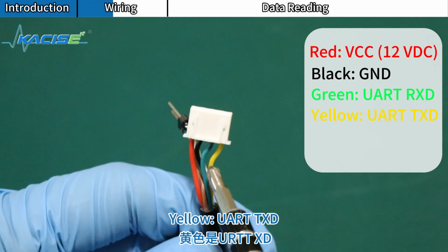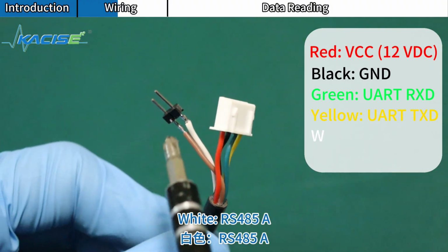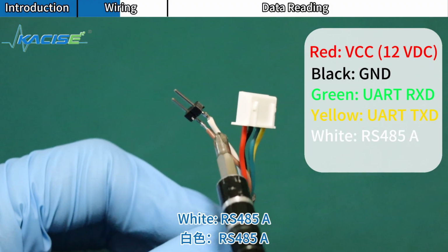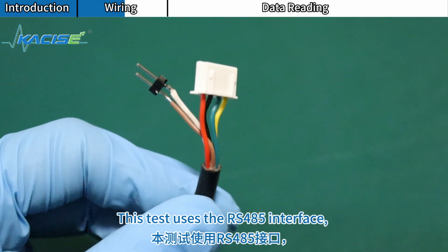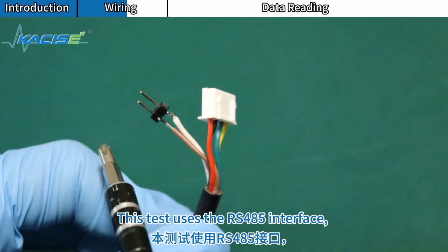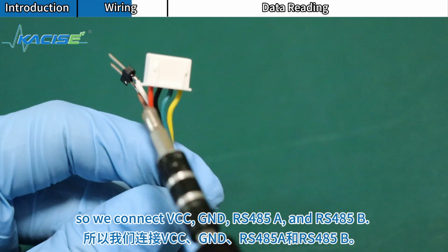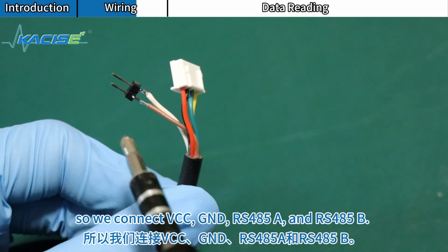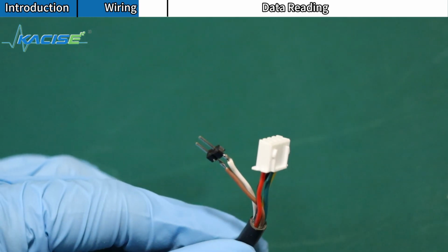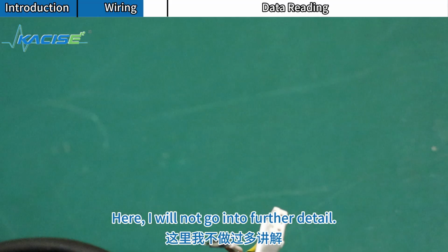Yellow, UART TXD. White, RS-485A. Brown, RS-485B. This test uses the RS-485 interface. So we connect VCC, GND, RS-485A, and RS-485B. Here, I will not go into further detail.